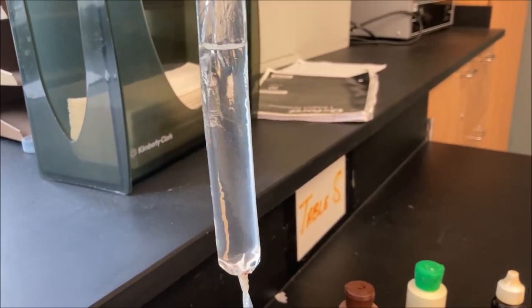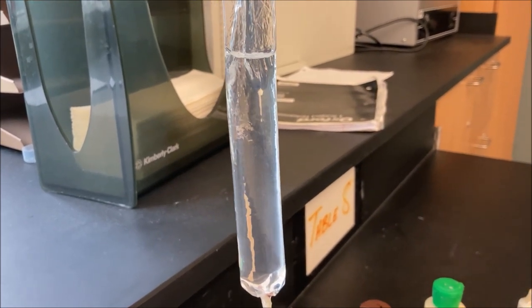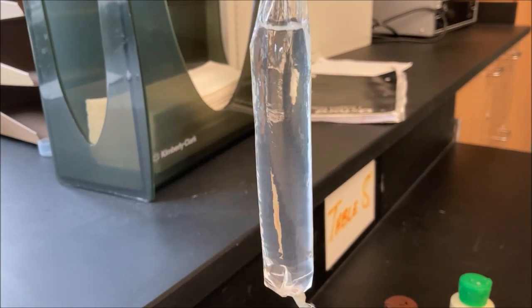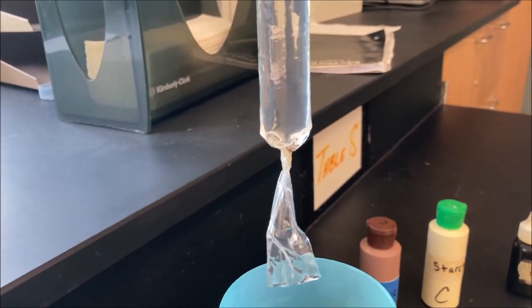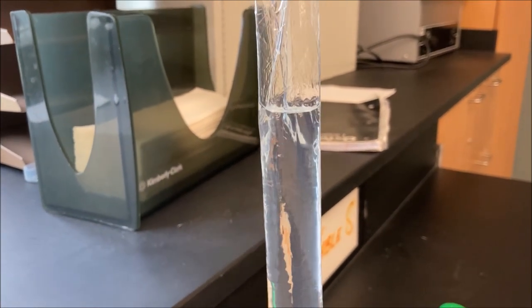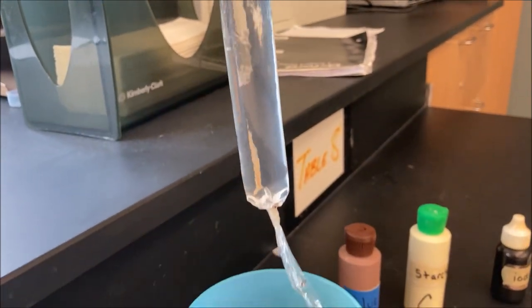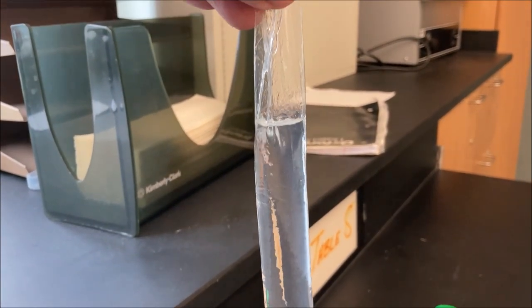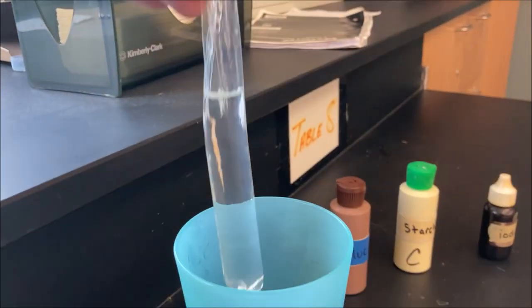Dialysis tube has incredibly small microscopic pores and holes that certain molecules can pass through. The point of this lab activity is to test our understanding of diffusion and passive transport — to figure out what molecules might be able to pass through the pores, the little holes in dialysis tubing.